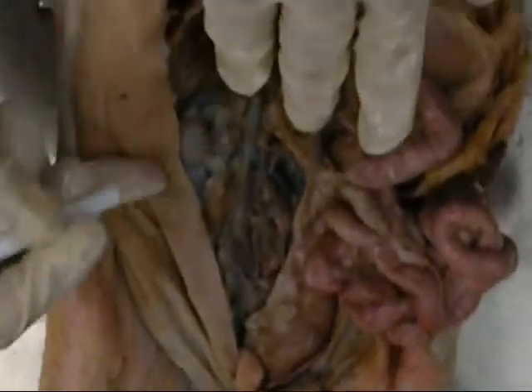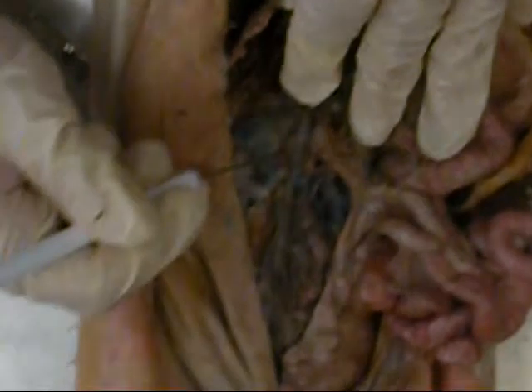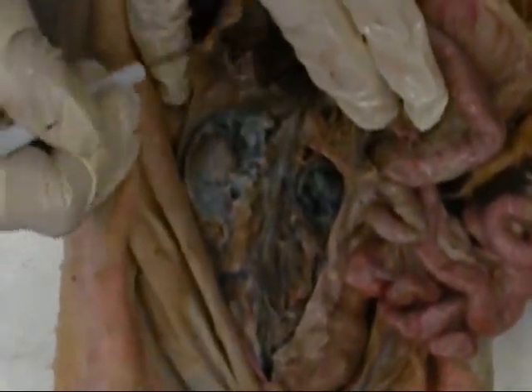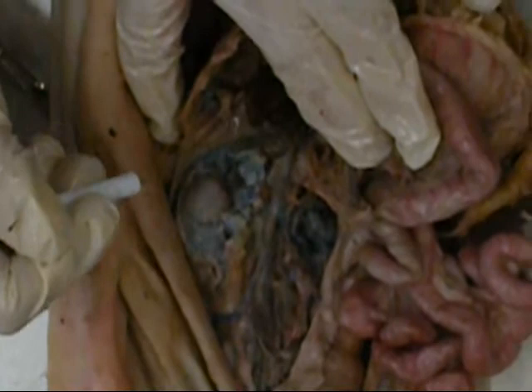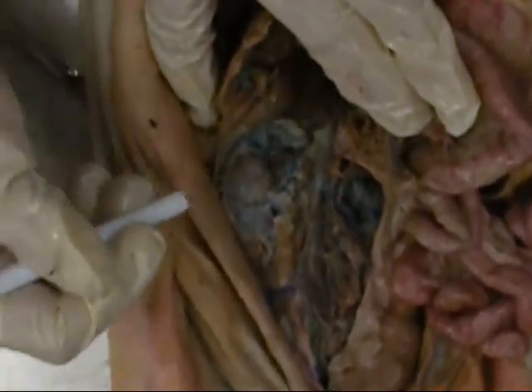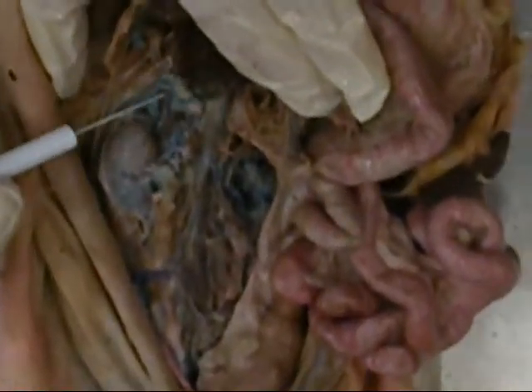When we get to the urinary system structures, the superiormost structure that you all are addressing is the adrenal gland. The adrenal gland is superior to the kidneys, and it sits in the same fat pad, but it has its own capsule and is completely separate. The tissue is very similar to that of the pancreas. So we have the adrenal gland, then in this case the right adrenal gland, right kidney.